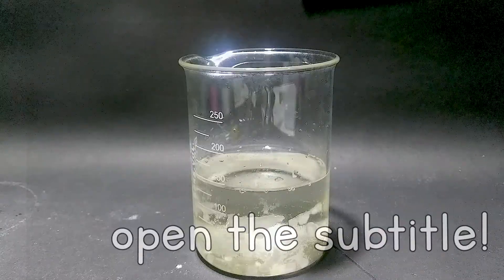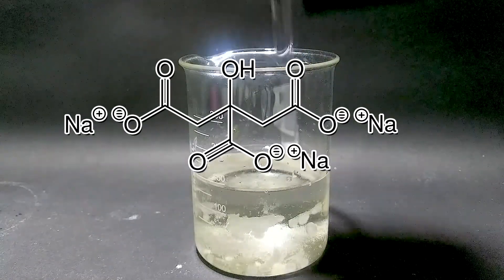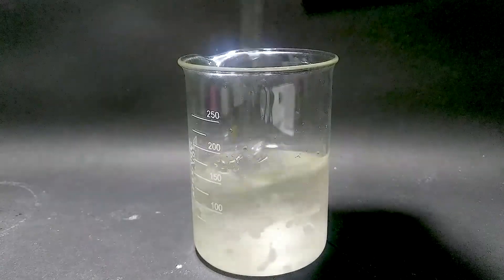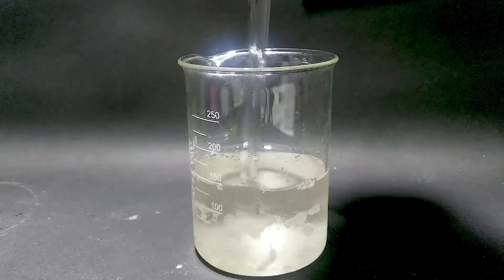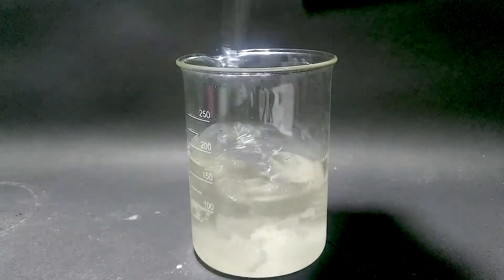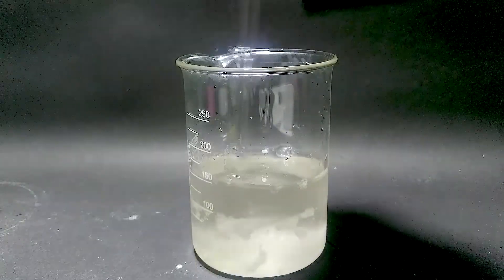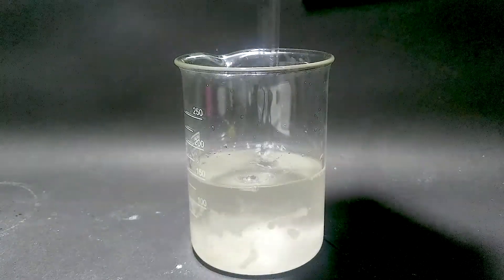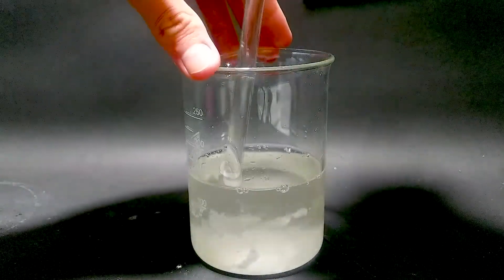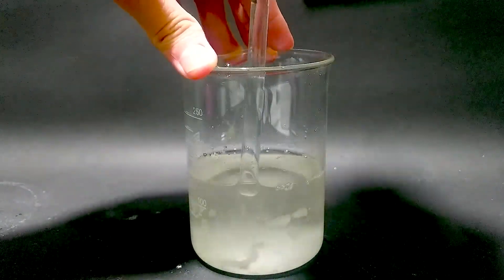Today, I'm going to synthesize sodium citrate. Why? Because sodium citrate is a basic compound to make a few kinds of citrate salts. Since sodium citrate is soluble in water, and some citrate-based salts like calcium citrate and zinc citrate are insoluble or only slightly soluble in water.